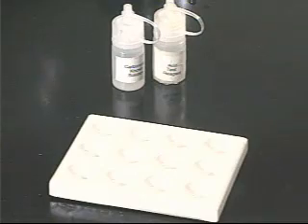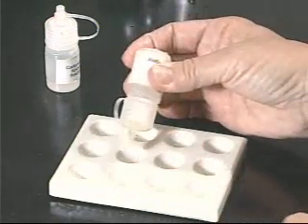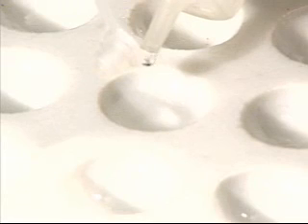Let's look next at the formation of a gas. I'll add the reagents necessary for the test — the known anion and then the test reagent. You may not be able to see this on the screen, but there are tiny bubbles forming. When you do this test, observe very closely and you'll see these tiny bubbles coming up from the bottom of the well. This is the formation of a gas.